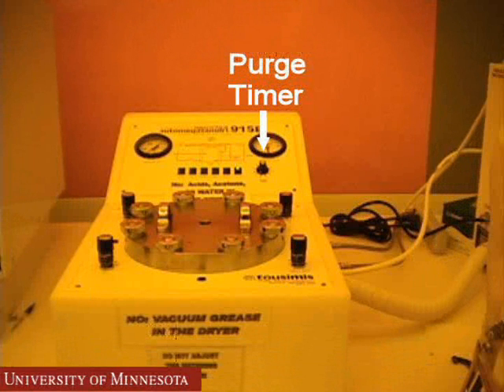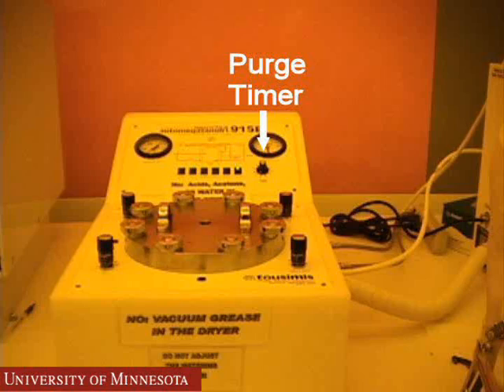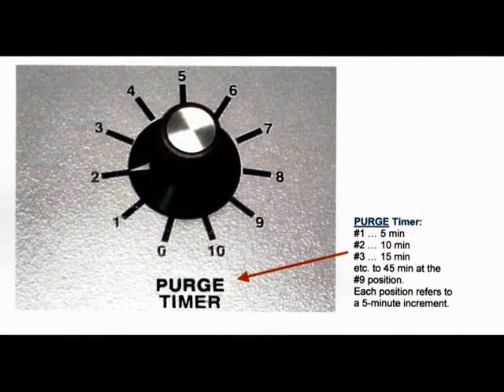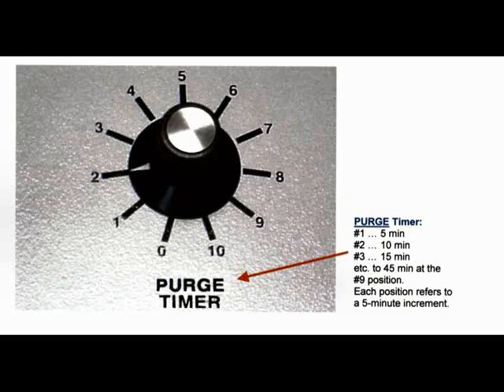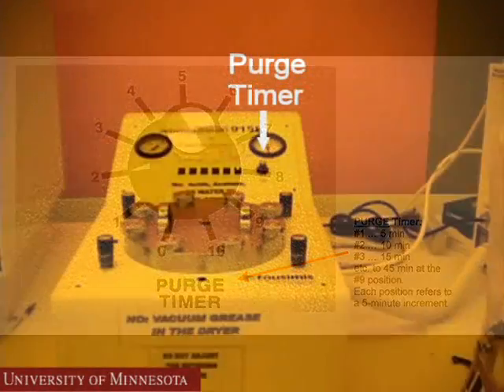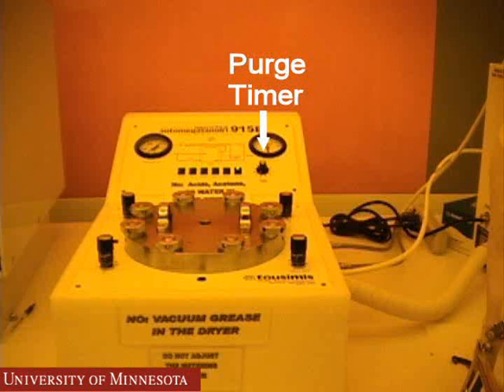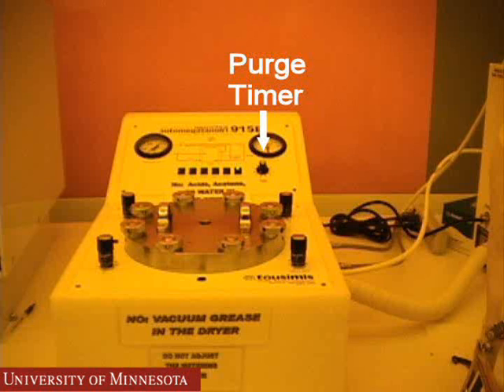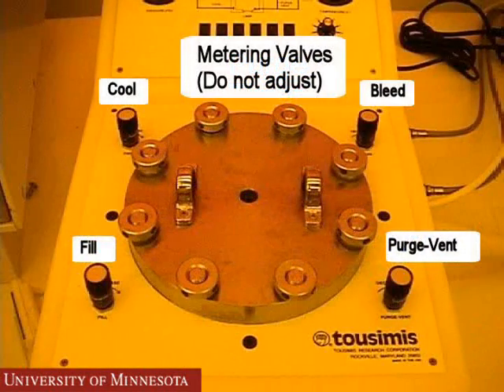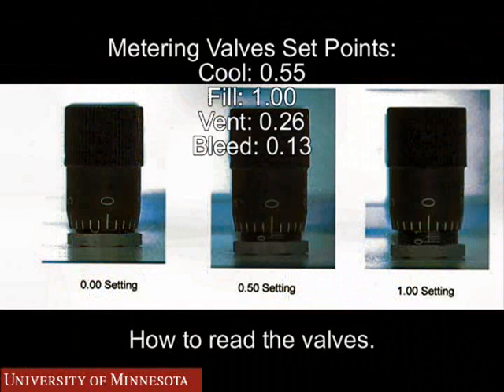Go to the purge timer and select the amount of time to purge the chamber with liquid CO2. The amount of time will depend on how full the chamber is filled with solvent. Each number represents a five-minute time increment. A typical purge time will be between 10 and 25 minutes. There are also metering valves around the lid. These are set to specific values that should not be adjusted.